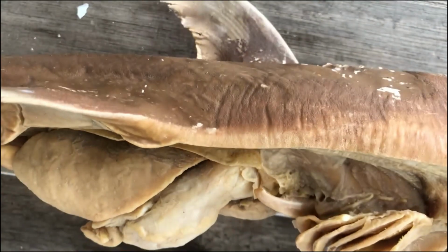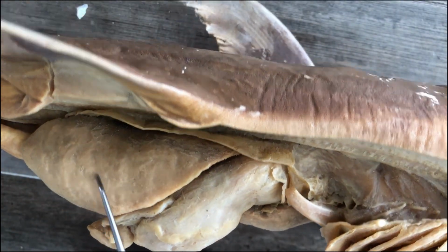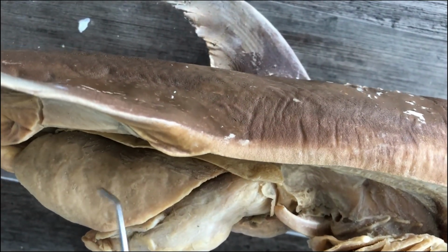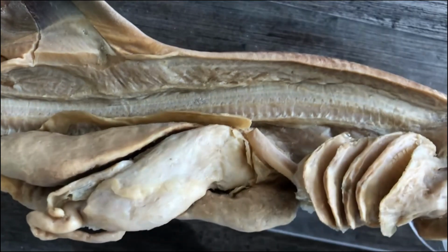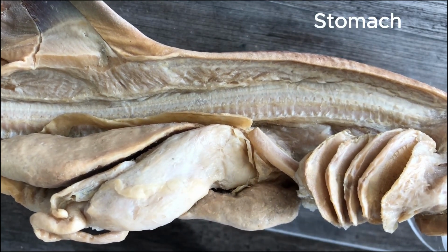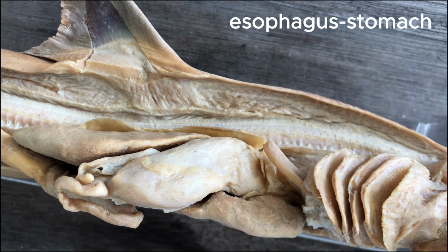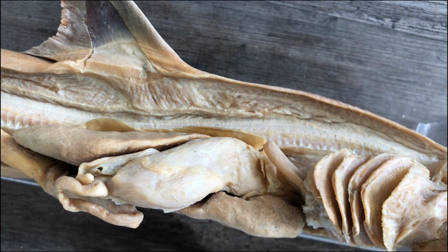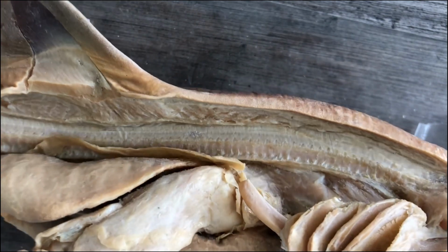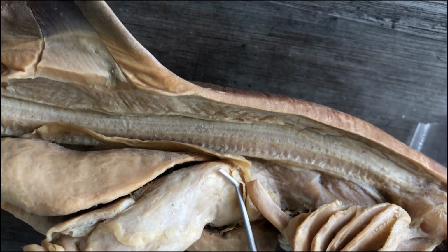So this one, dorsal view. This is one of the lobes of the liver. I think this is the right lobe of the liver. And this sac-like organ here is actually the stomach. In the shark, sometimes referred to as the esophagus stomach, because in the case of the shark, there's no clear boundary between the esophagus and the stomach. So it's either the esophagus stomach or the stomach.